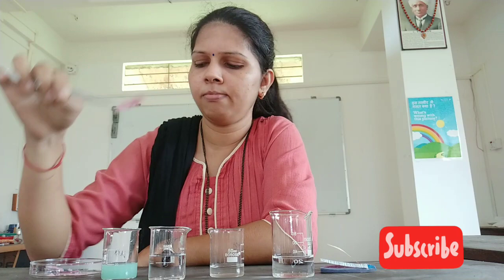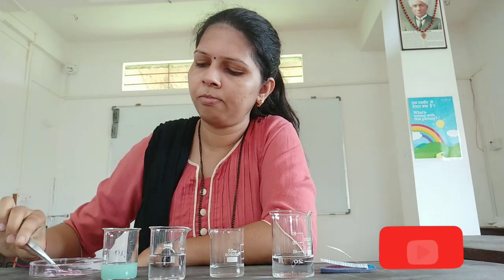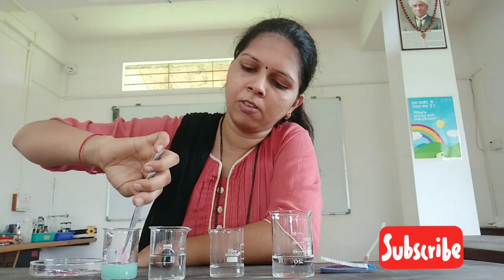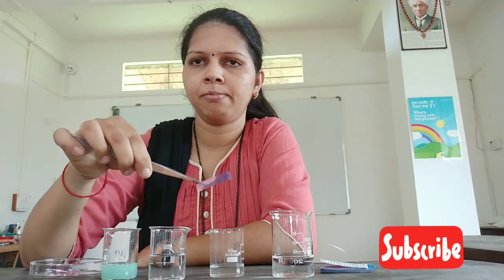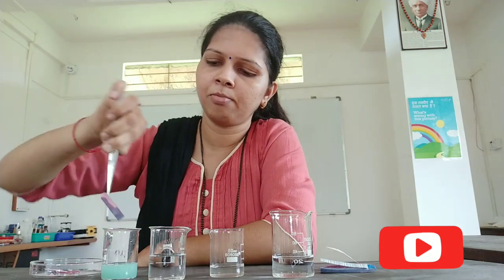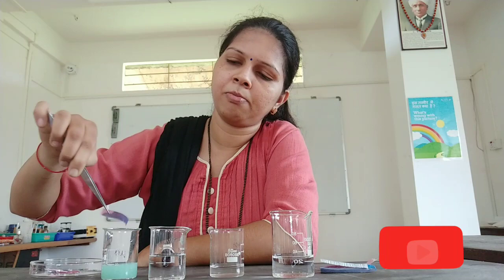In beaker C, you will find the litmus paper remains the same — there is no color change. And let us take the red litmus paper and dip it in beaker D. You will notice that when dipped in beaker D, the litmus paper changes to blue.